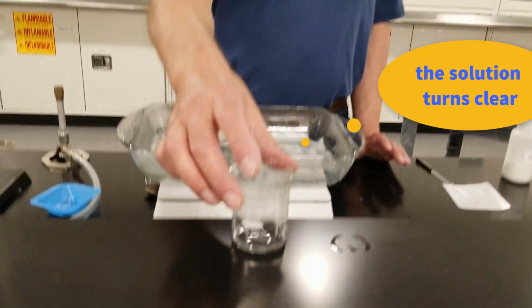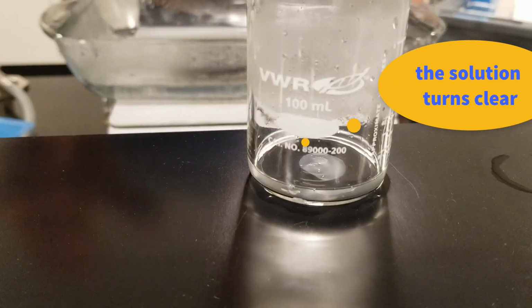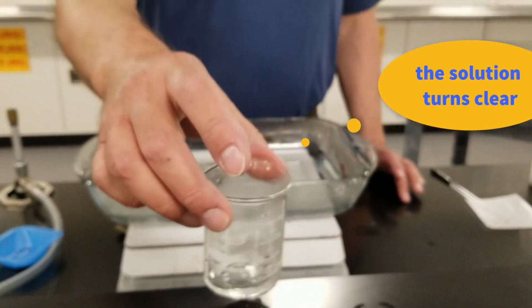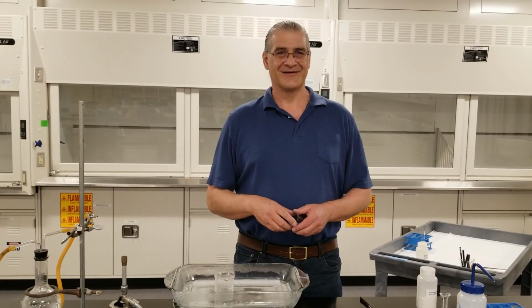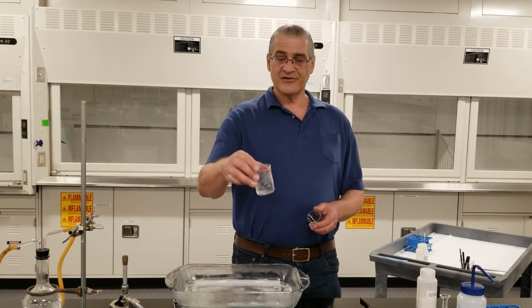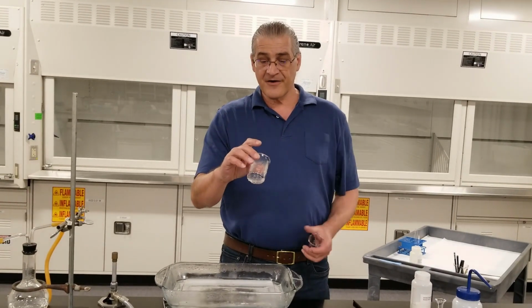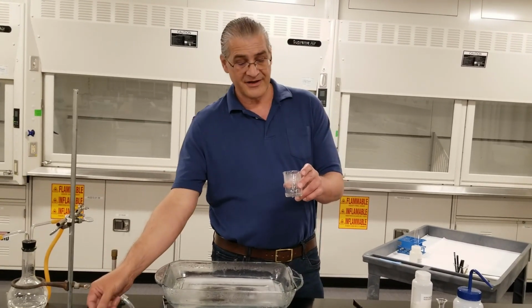Here's my solution now, and you can see how all of that potassium bitartrate has dissolved after it's reacted with the sodium carbonate. Okay, so here's my Rochelle salt. There's some little specks of unreacted sodium carbonate in there.